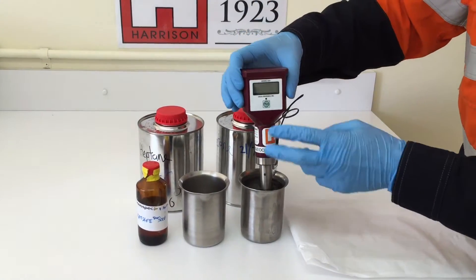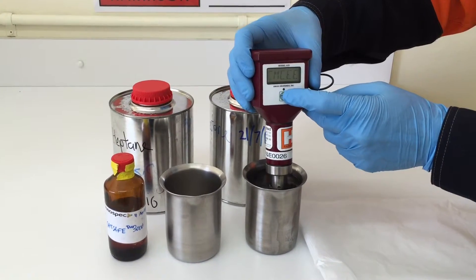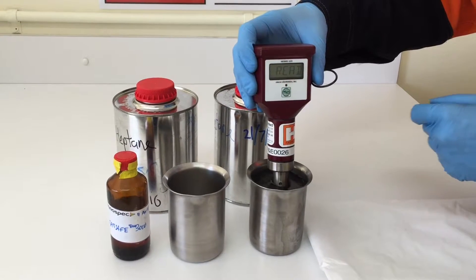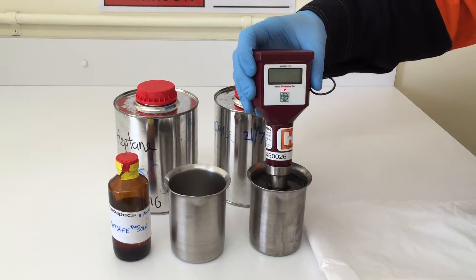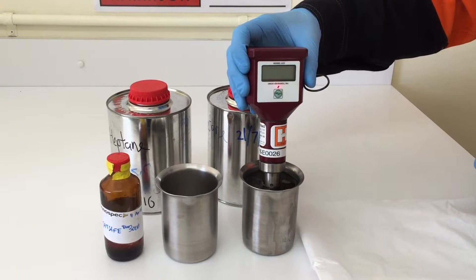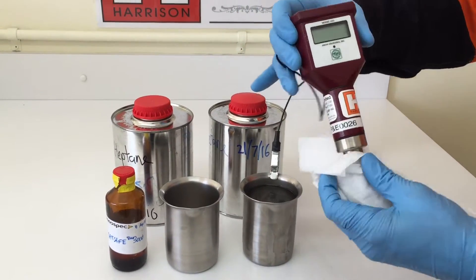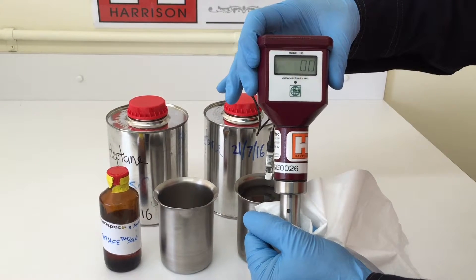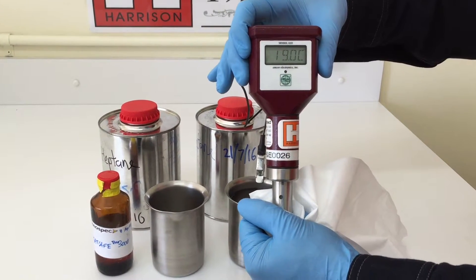Then we insert the probe up to the holes and press the button once. Once the meter starts we press it again and it will start to read. The light flashing indicates that it's measuring the conductivity. Once the light turns off we can remove it from the sample. As you can see, the conductivity of pure heptane is zero at 19 degrees Celsius.